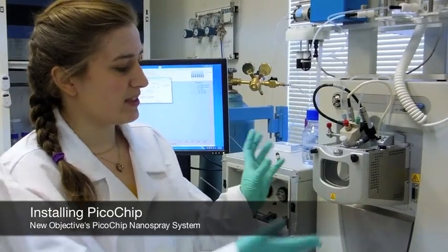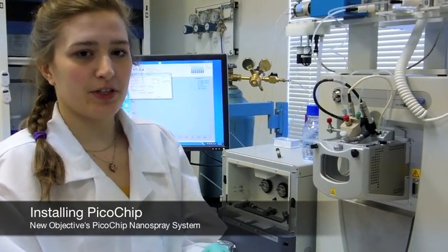Hi, my name is Katherine. I'm an undergraduate working at New Objective. Today I'm going to show you how easy it is to switch from a standard ESI source to a Picochip source.